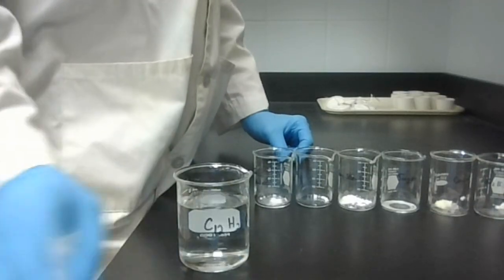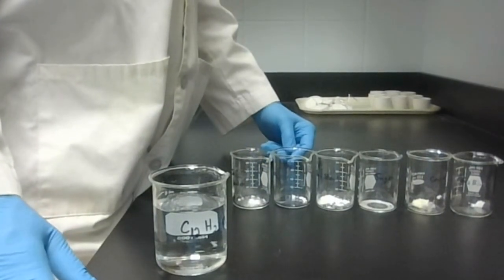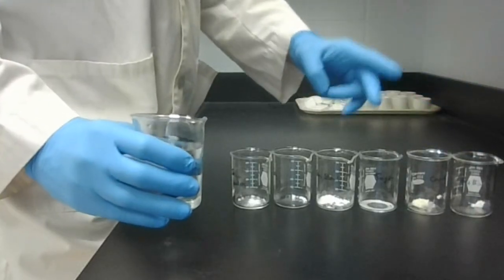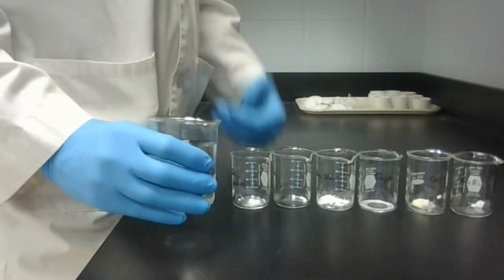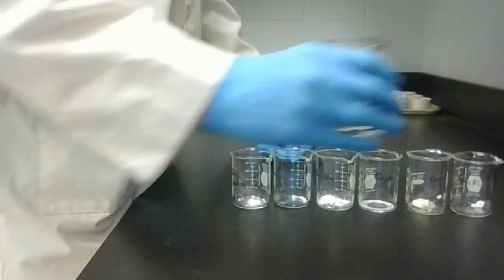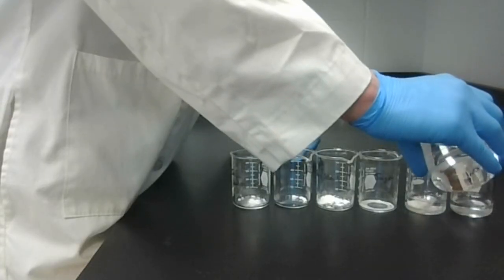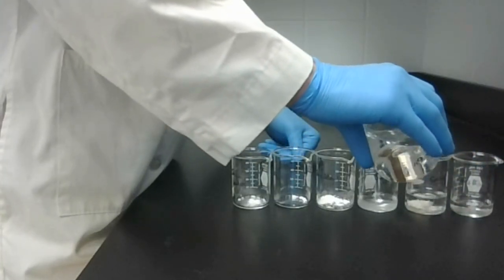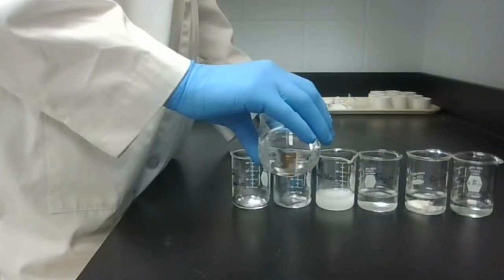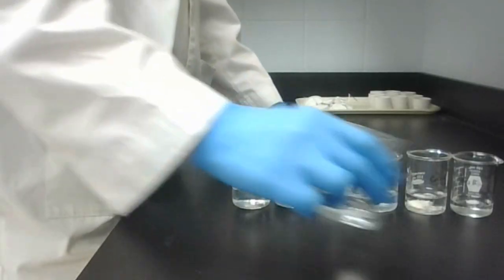Our next test is the solubility test. For this test, we're going to see, does our sample dissolve in water? I will pour a little bit of this distilled water on top of each of our 6 samples, and then I will pause the video and show you what the results are after swirling these for a minute. So over the paraffin wax, over the Crisco, I'm just dumping about 20 milliliters or so of distilled water. We'll come back to these results in about 1 minute or so to see if these actually dissolved with a little bit of manual swirling.